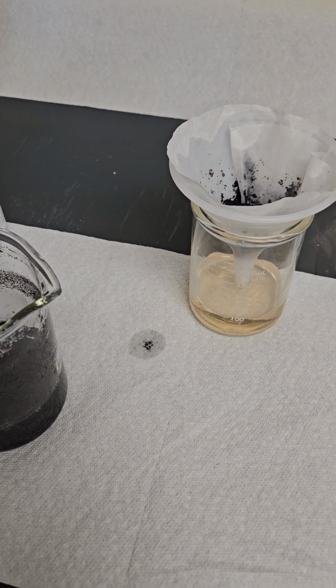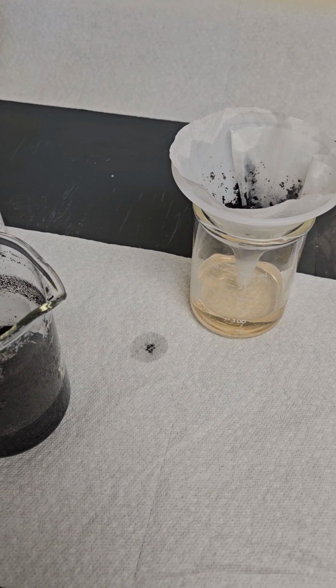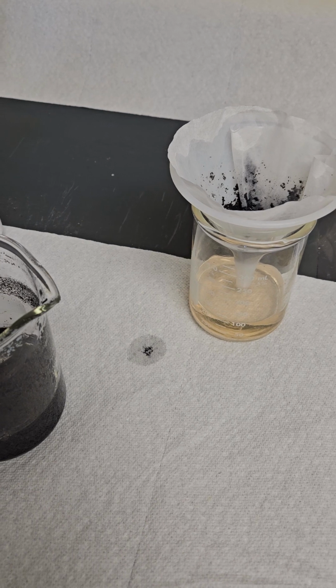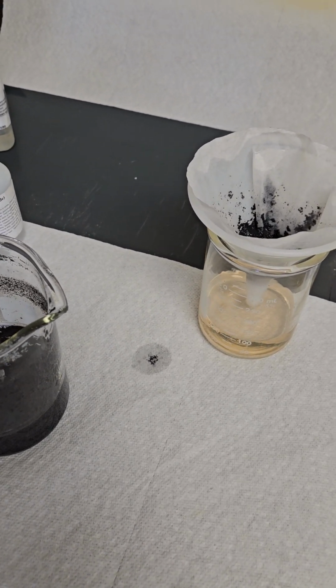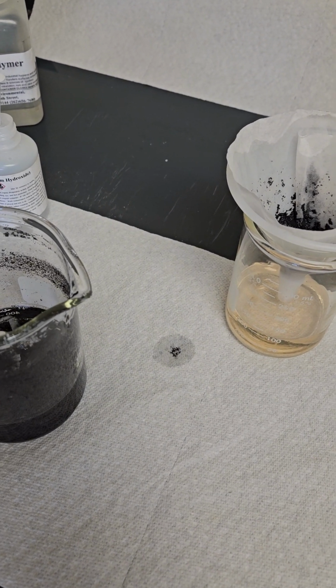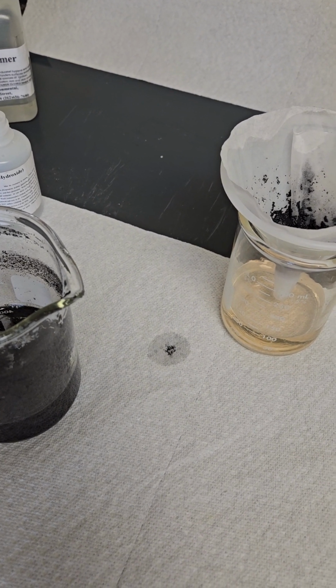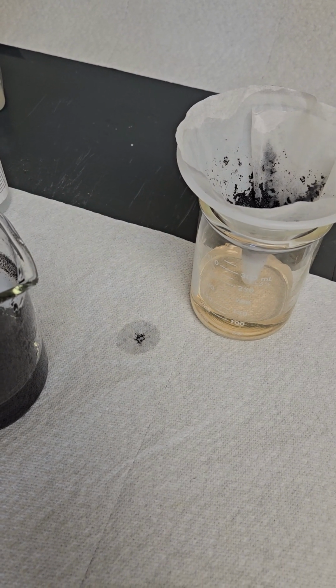It's 1.5 per 500. No, what is it? 0.15 times 4. It's only 2, 3, 4, 5. So it's like 0.5. It's like half a gallon per 1,000 gallons. It's not too much caustic necessary.